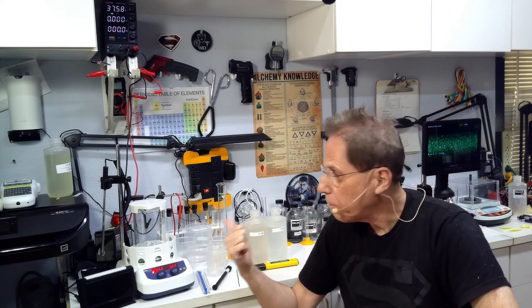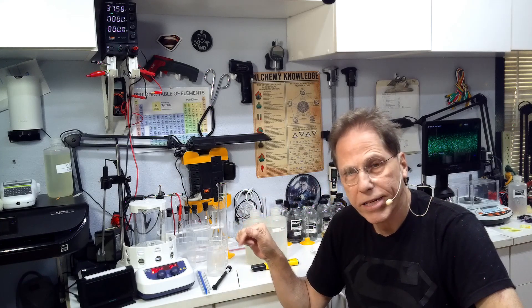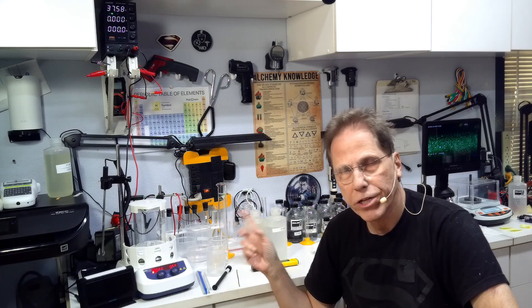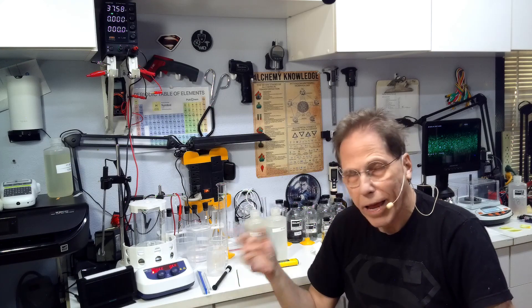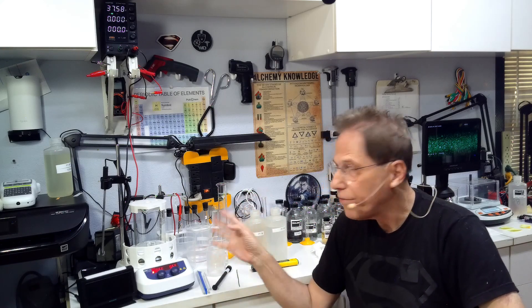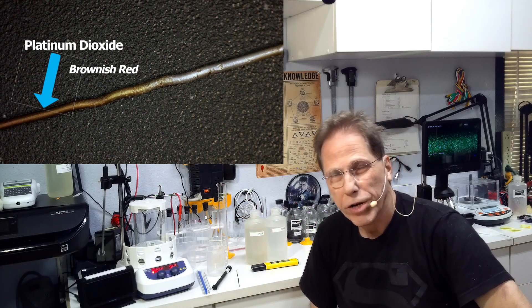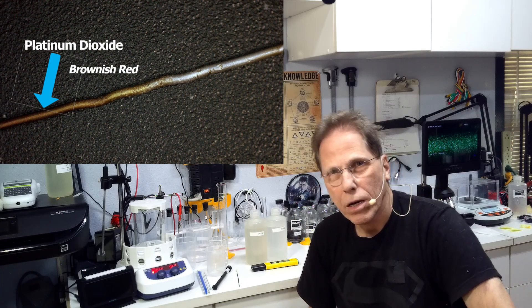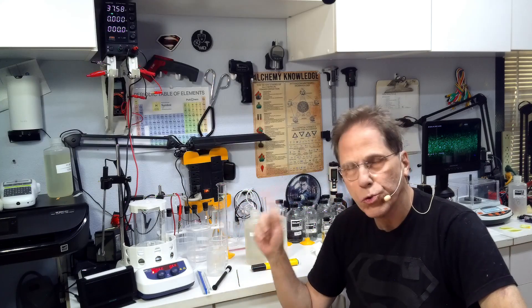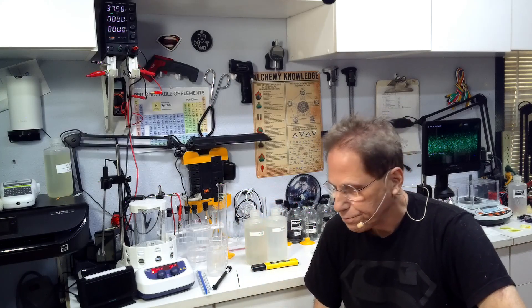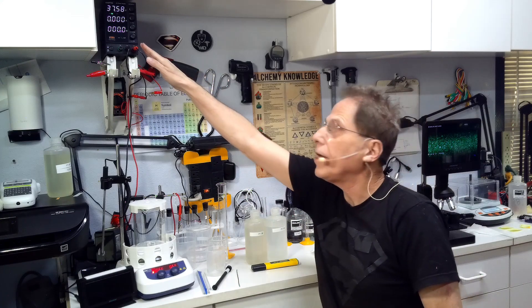The only way I've gotten the platinum dioxide off is that when you put it in the next process to cook it, the platinum dioxide is burned off in the very beginning part of the process. So the more platinum dioxide you have on there, the less platinum you're going to get off in the process down the road, because the platinum is not going to come off until the platinum dioxide is off. You're going to need some specialized equipment. First, you need a power supply capable of locking the current.